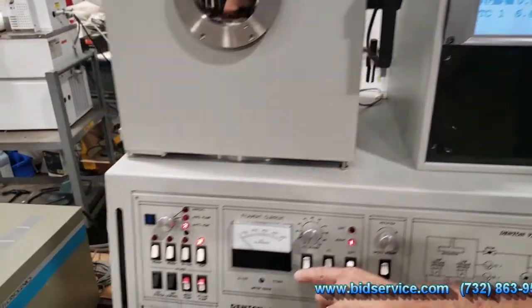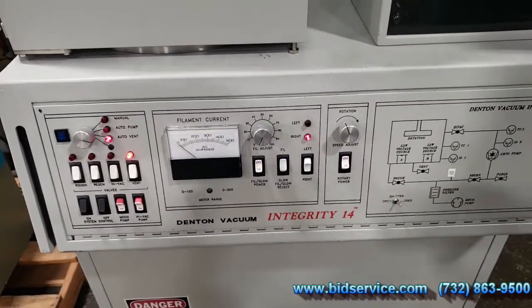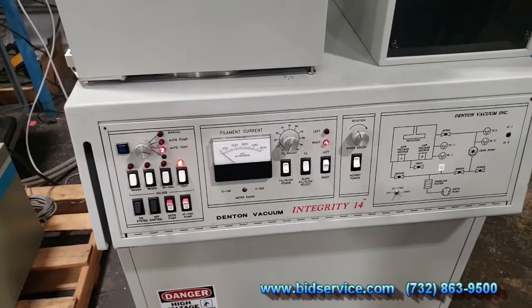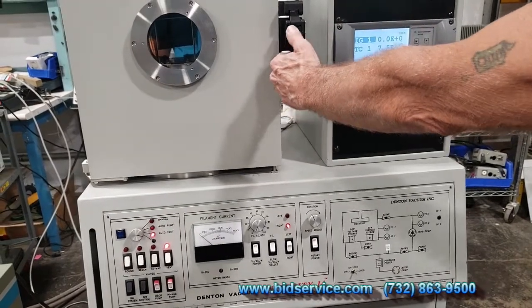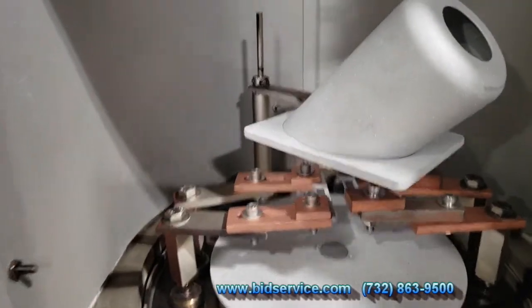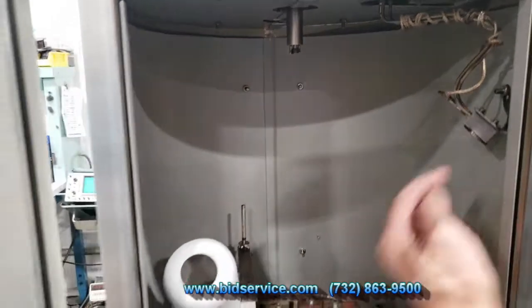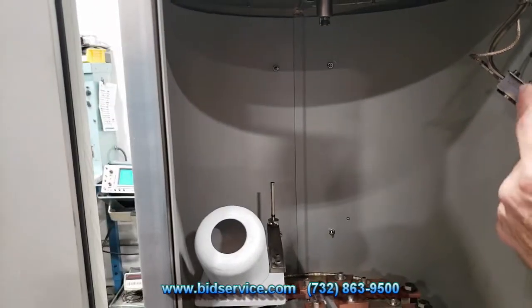The sources can put out up to close to 500 amps through a boat of this size. You can now take a look inside — it's very clean. Here's the shutter; let me open it. You can see your left and your right source set up. The shutter has an opening so that before fully opening it you can monitor the deposition rate using the crystal monitor.